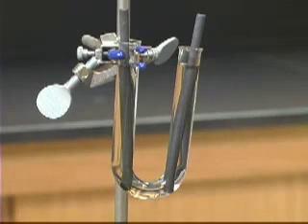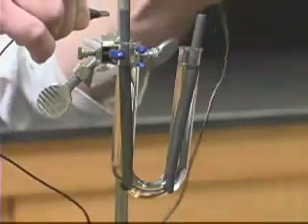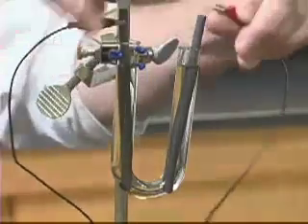We've placed a solution of potassium iodide in the U-tube. The potassium iodide contains a small amount of phenolphthalein. Phenolphthalein is an acid-base indicator that changes from colorless to pink in basic solution. We've placed inert graphite electrodes into the U-tube.